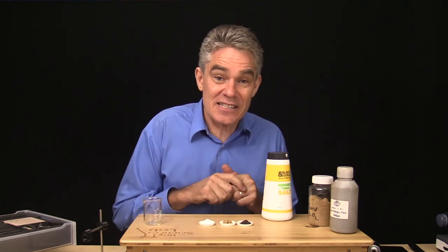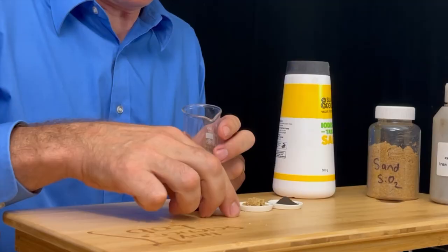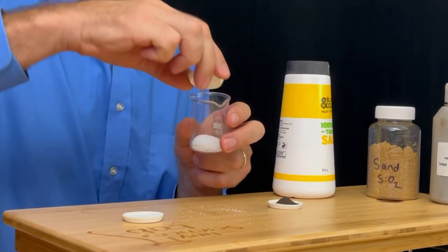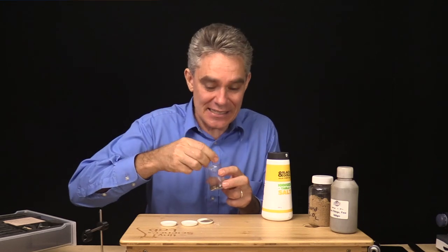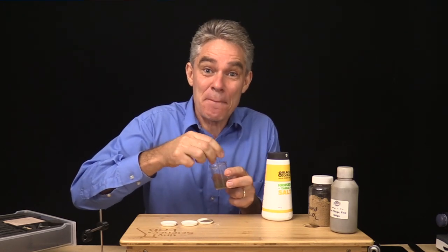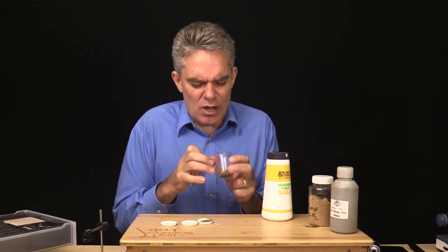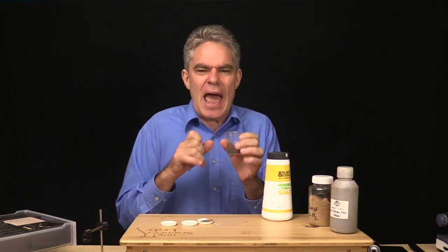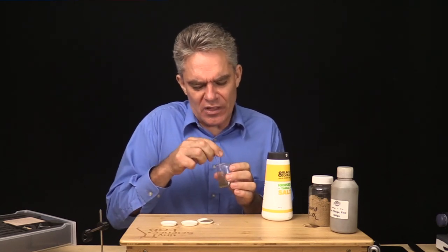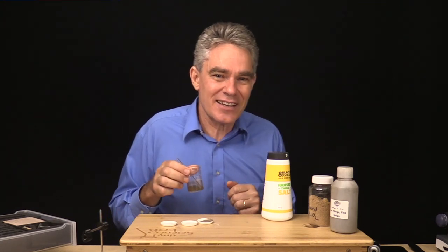So I've got two compounds and one element, but they're all pure substances: compound sodium chloride, compound silicon dioxide, element iron. Now it's time to make the mixture — in goes the salt, in goes the sand, and in goes the iron filings. Let's give them a mix, because a mixture has got a few things mixed together. Those three substances have not bonded together — they're almost three separate things just sort of hanging out in the one place.